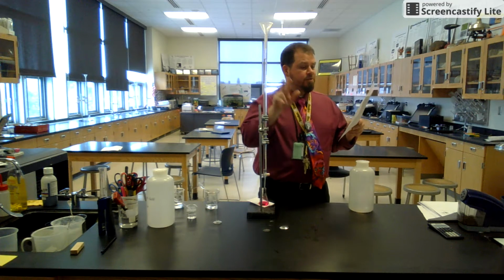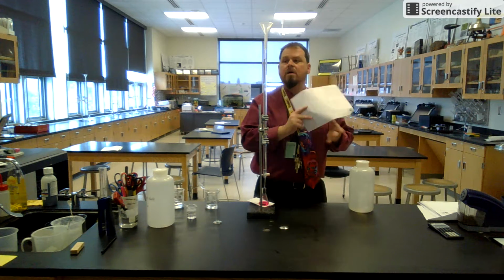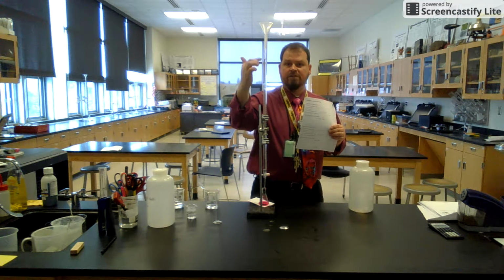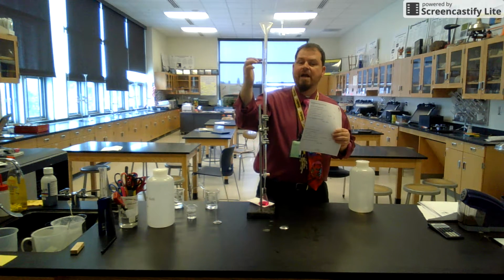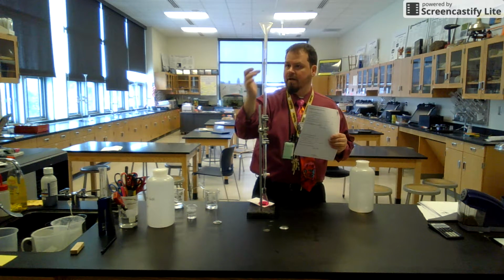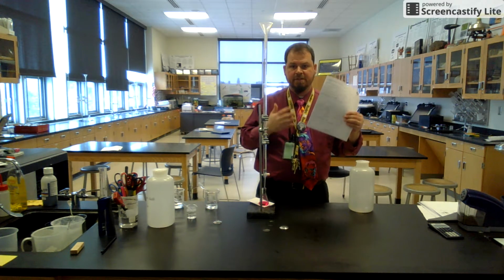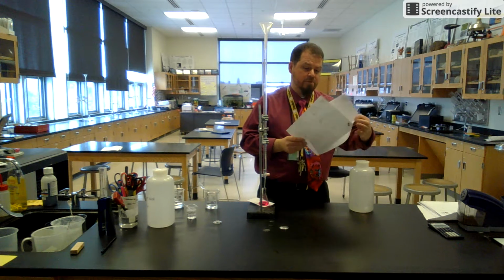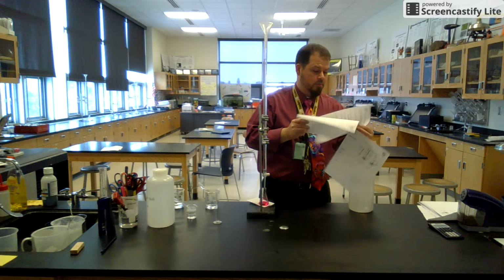You're going to do this 3 times at a minimum. I just now have a new starting point for my base as far as milliliters goes. You do not need to fill this back up to 0 every time. Just start with a new starting point and a new ending point and do the calculations. You can top the base off at the end if you want, but you can leave that up to the next group too. So we just went through the whole lab.